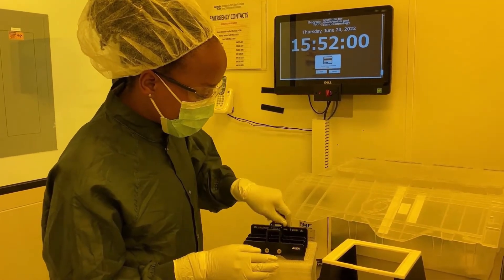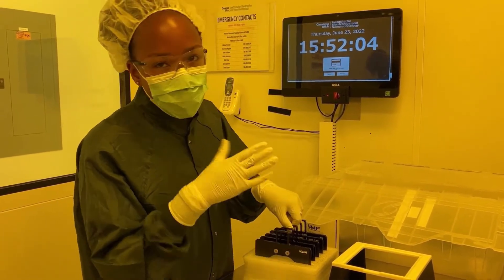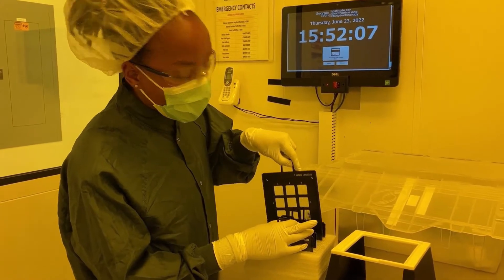At Georgia Tech, there are 5 holders available, but if there are any holders or substrates you want to use that are not provided, you can contact the IEN staff and they will help you out.